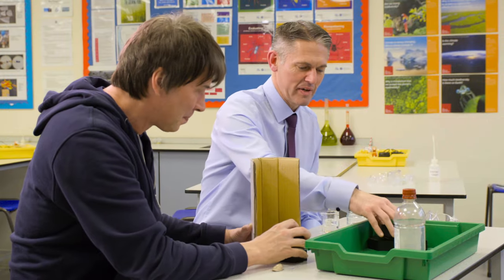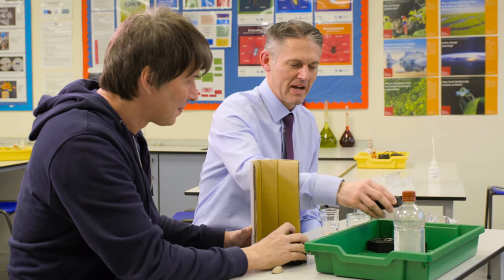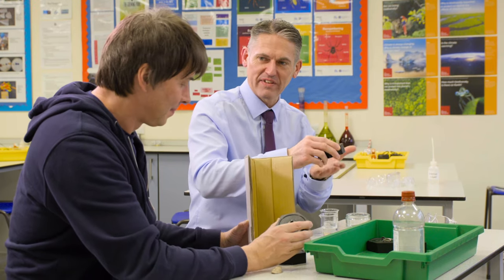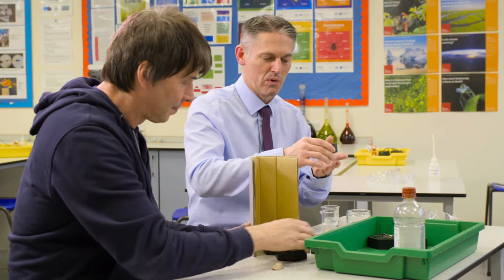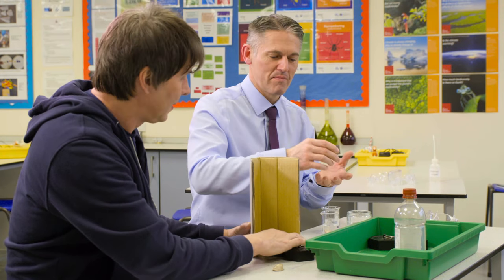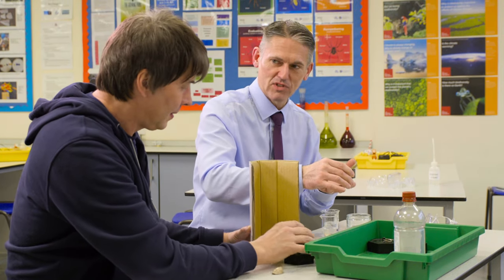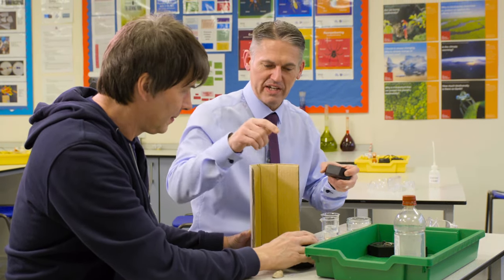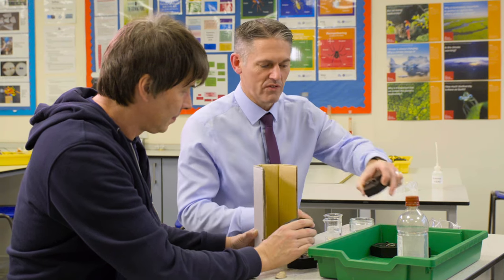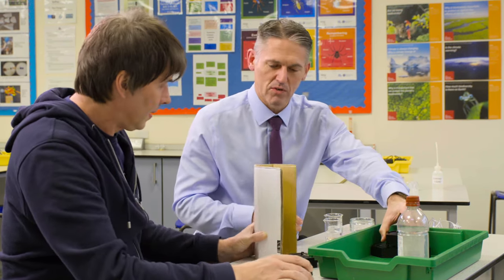There are plenty of health and safety considerations. Not only are we worried about the masses falling off the table, but we're also worried about trapped fingers underneath them. It's important that students don't drop them onto the shell — they place them gently. If you have it facing inwards on the table, there's less chance of them falling off.